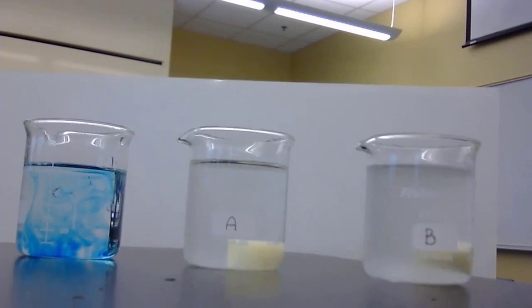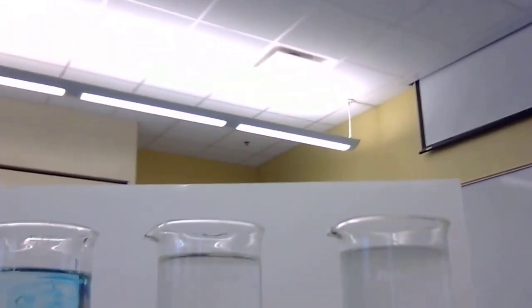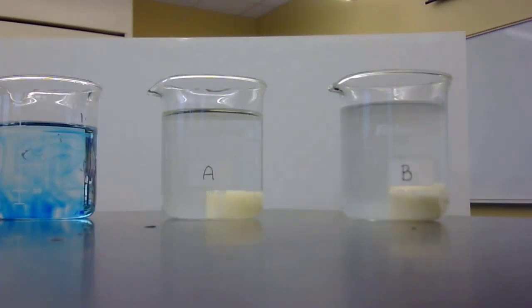For potato B, let's tare that. Okay, and piece of potato B, we get a weight of that. And that is, again, if you can see it, it is 5.47 grams. So we're going to take that and we're going to put it in the very salty water over here. And we're going to let that set for about an hour and see if there's any change that occurs, if any movement of water occurs going in or out of those potato chunks.